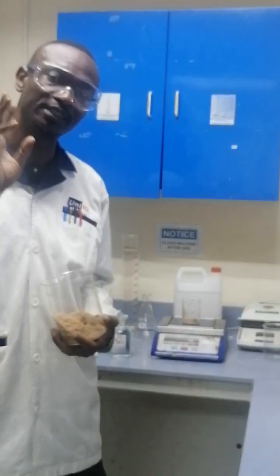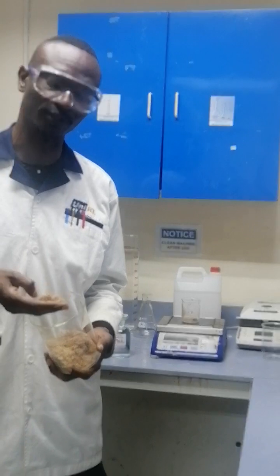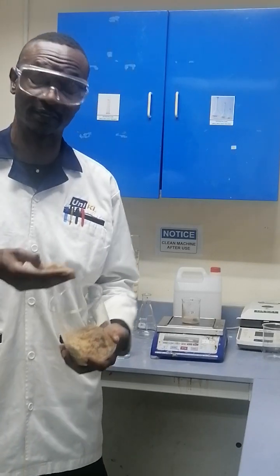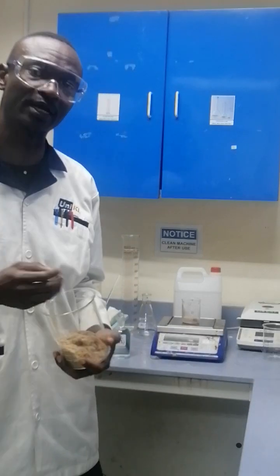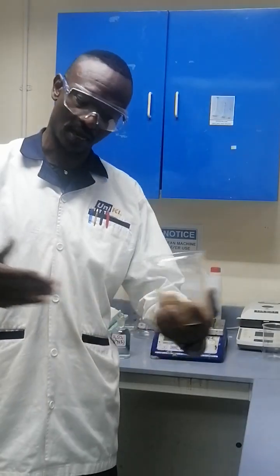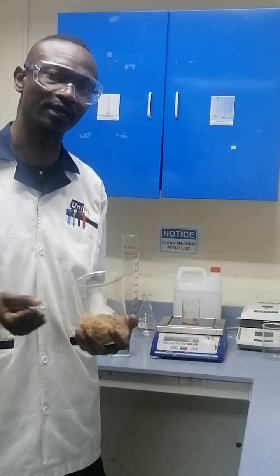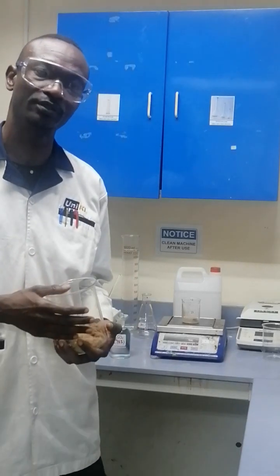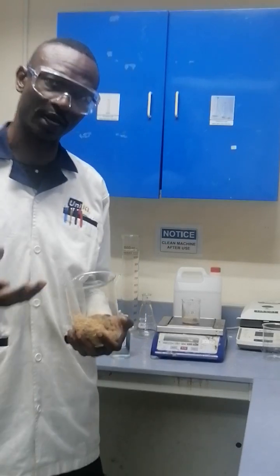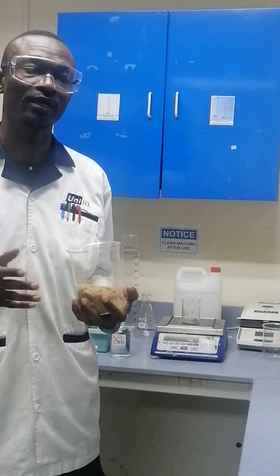In this video we will be carrying out the ASTM 1106 method of lignin extraction. This method consists of three main steps. The first step is to hydrolyze your plant biomass using 72% sulfuric acid in the cold — around 20 degrees Celsius. When using 72% sulfuric acid, heat is generated, so the reaction is carried out in the cold as it is exothermic.